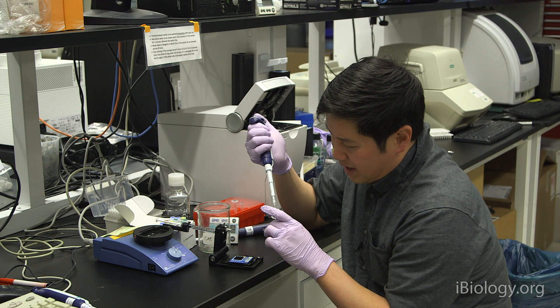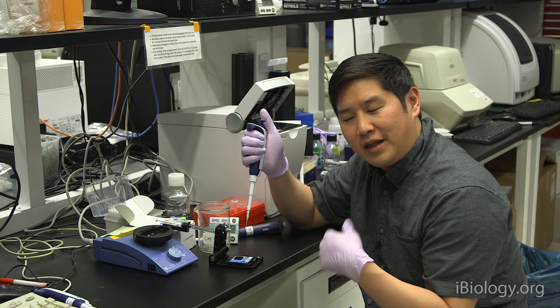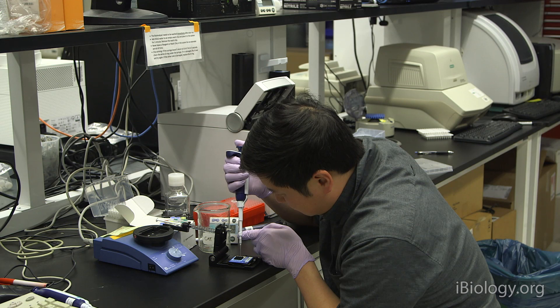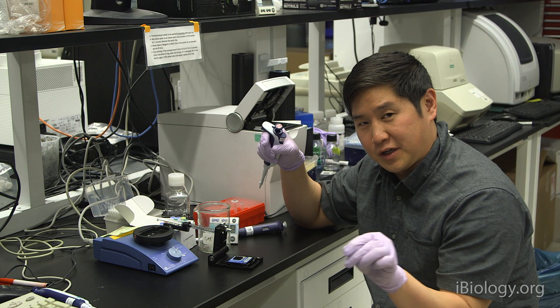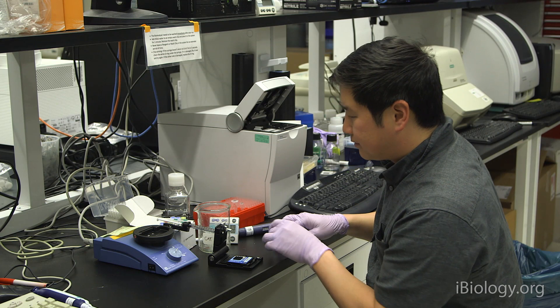When you add reagents to these chips, you want to make sure that you touch the bottom of the chip. You don't have to worry about marring them, because they're made out of glass, so they're much harder than your pipette tips. The other thing you want to make sure that you don't do is expel a bubble at the bottom of the chip, because that's where those capillaries and channels are. If you have an air bubble down there, it's going to disrupt the flow of current.